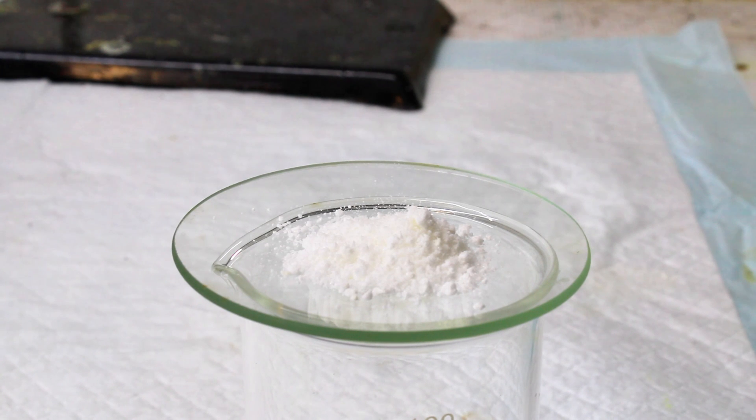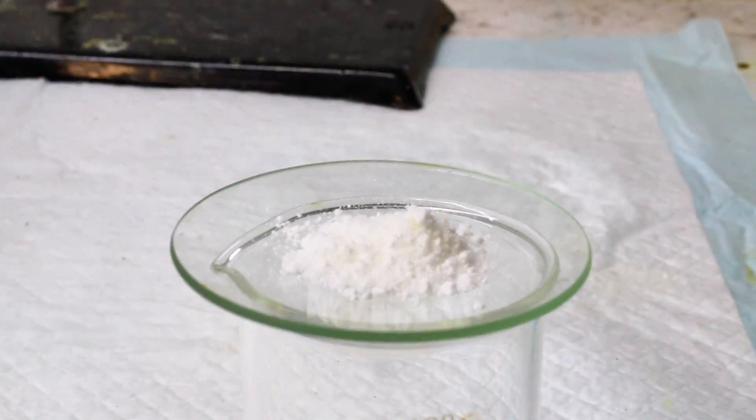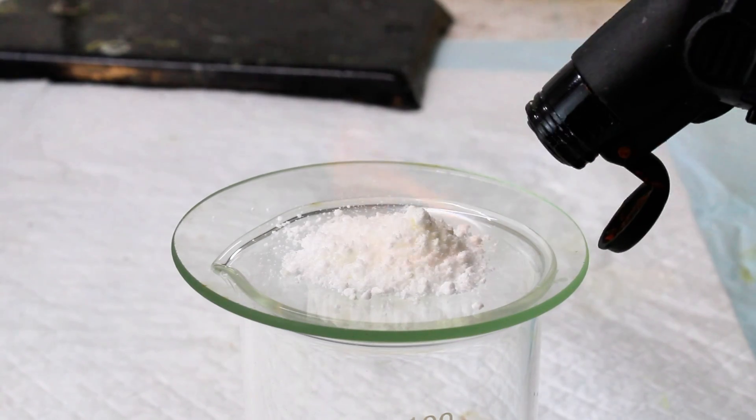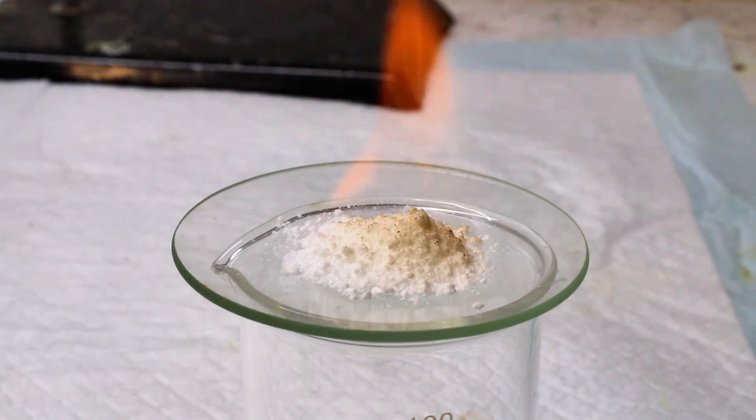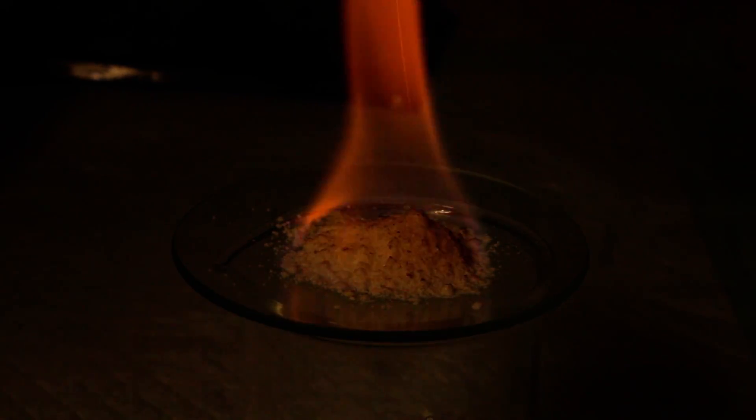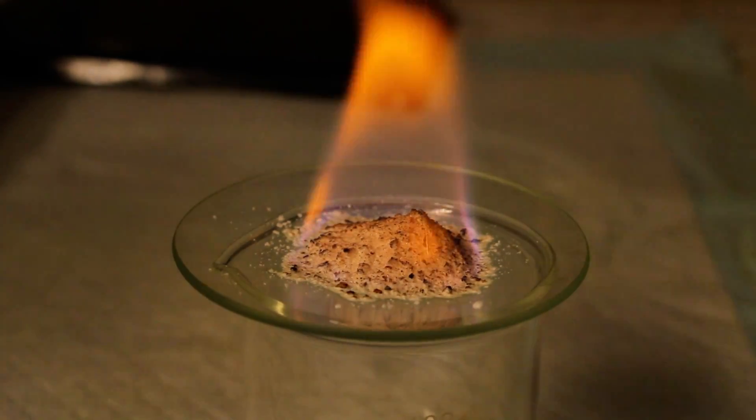As a quick demo, I'm going to ignite some of this hexamine so that you can see how it really does burn without producing any smoke whatsoever. Keep in mind however that it does produce invisible fumes that are toxic, so it's not completely safe.